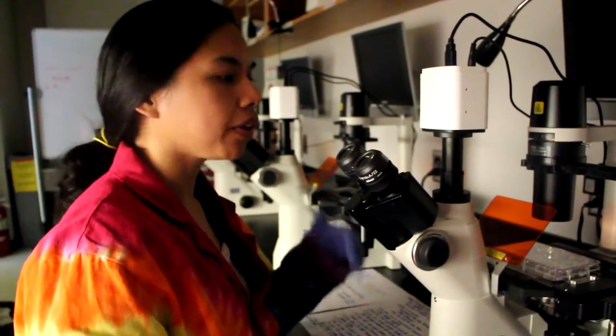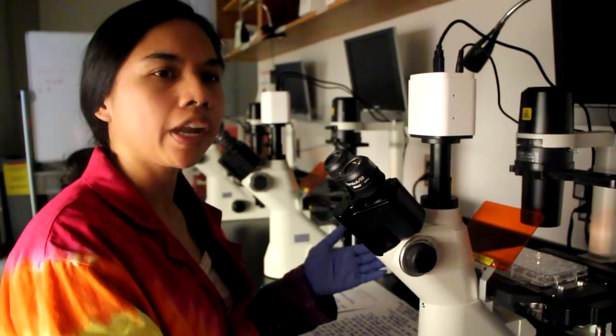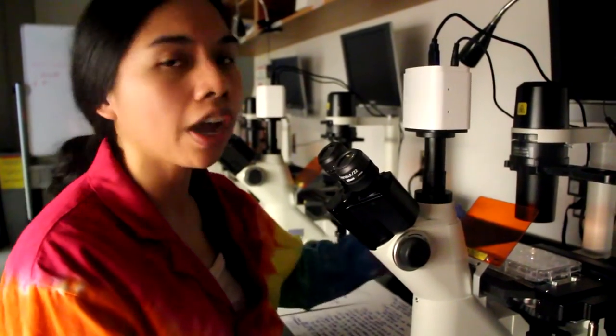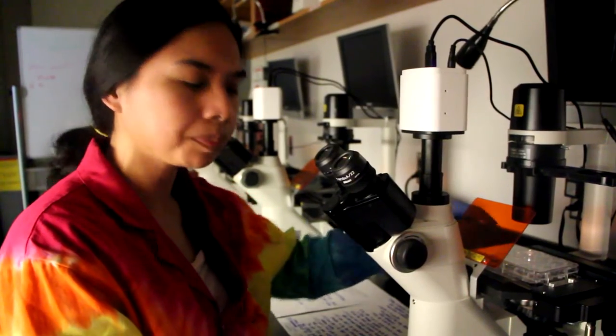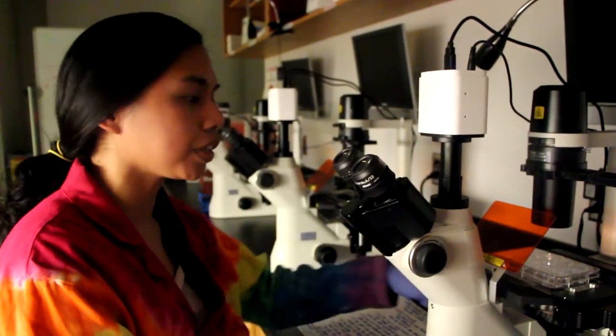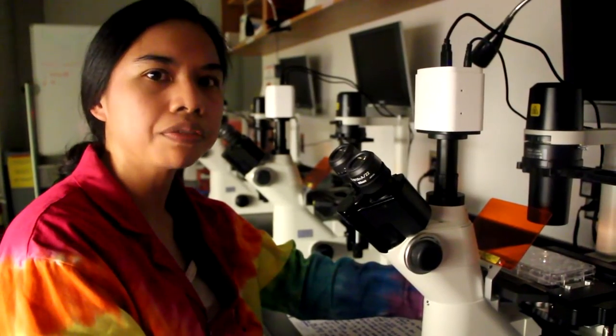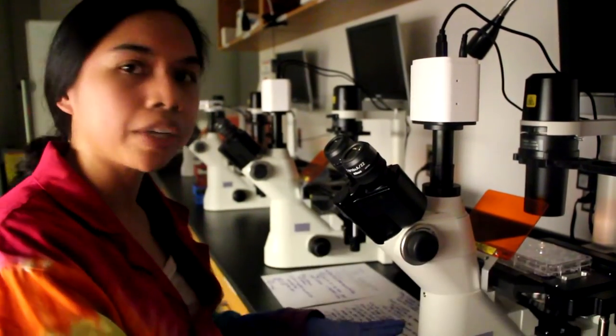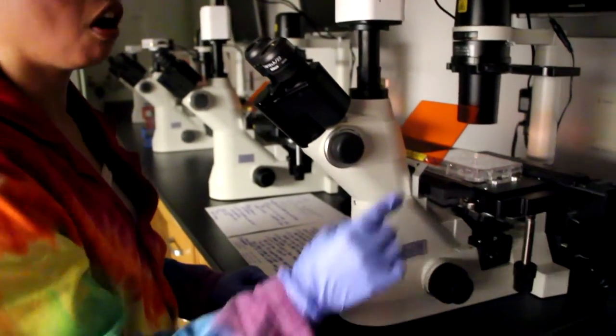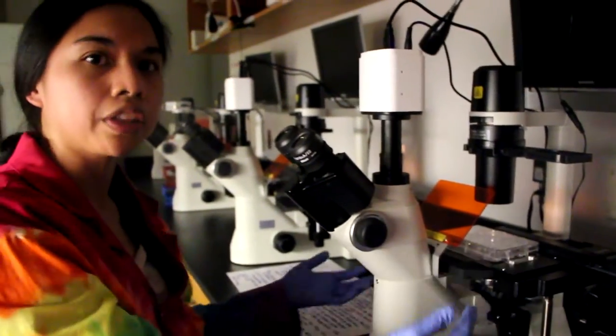Now that we've got our basics about how this microscope is set up, we can now start to focus on our cells. So I've got our plate already on the stage here. What we're going to do is we're going to use bright field. So we want to use the black 4x objective. We want to bring the objectives all the way down, and we do that by turning the coarse adjustment knob all the way towards the wall until it stops.